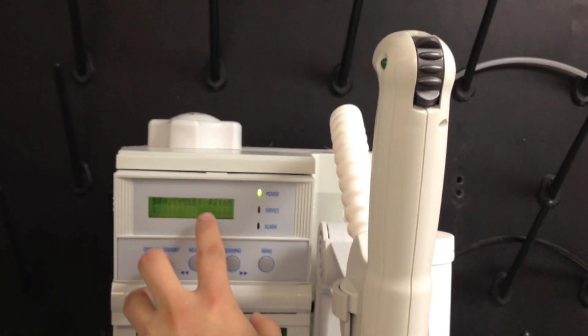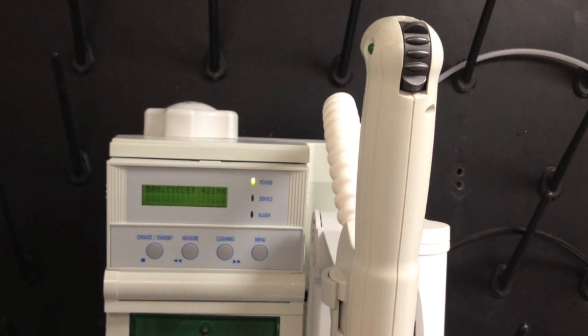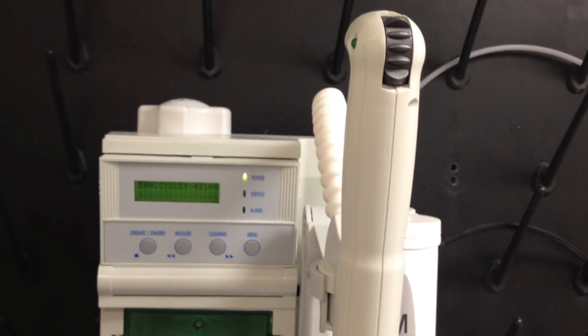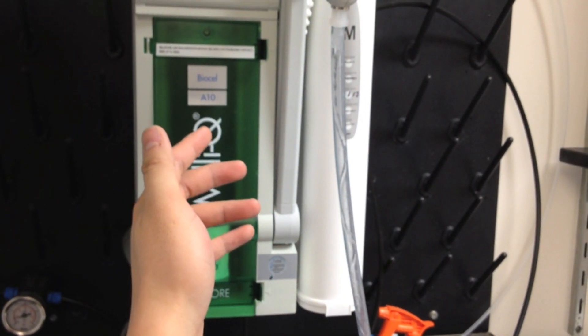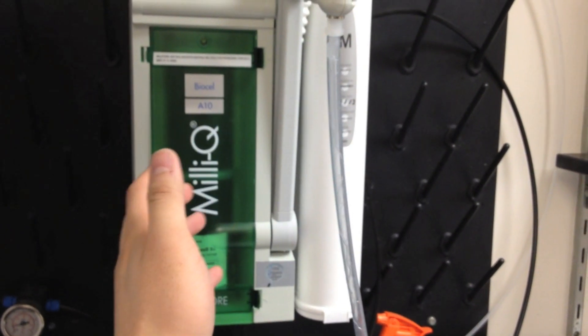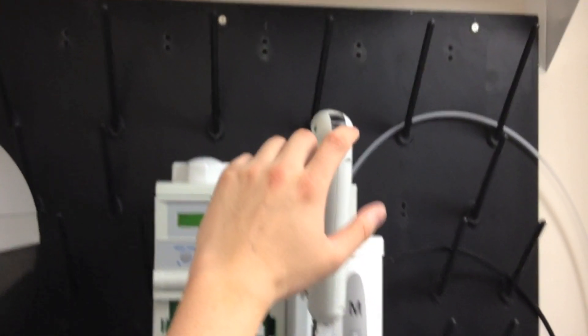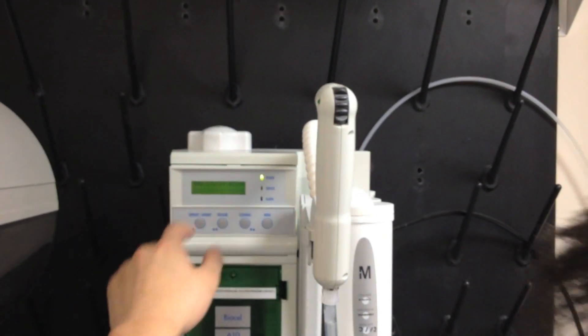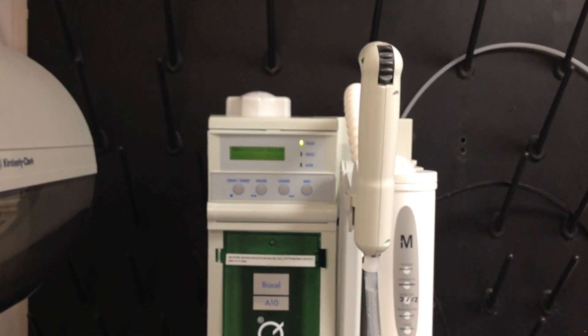The sanitation basically takes 420 minutes. The first 20 minutes, water will keep coming out, and here you need to set a timer. And at exactly 20 minutes later, you will need to close this valve. And this minute will go down, count down the last 400 minutes.